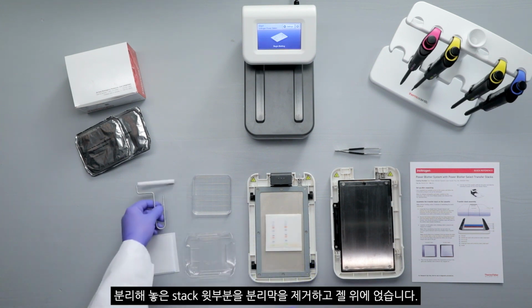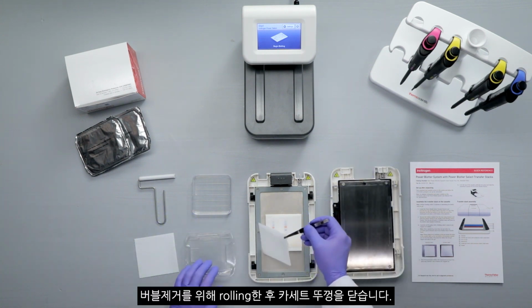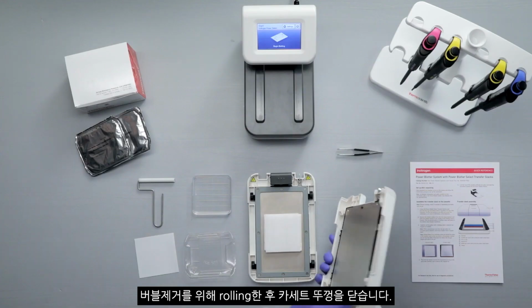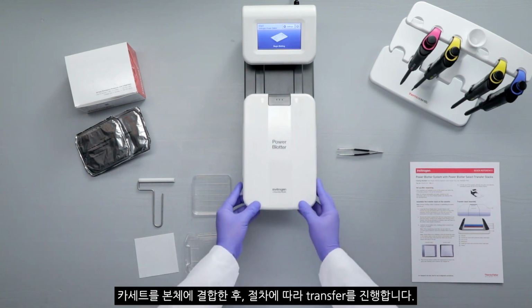Place the top cathode stack, without the separator, on the pre-run gel. Carefully roll to remove any air bubbles. Lock the top of the cassette, the cathode, into place and slide the assembled cassette into the Power Blotter station.